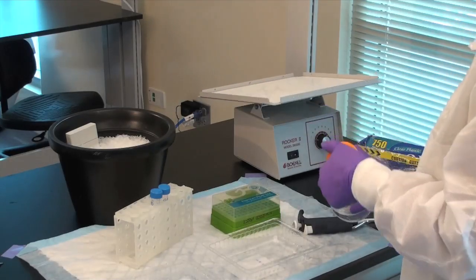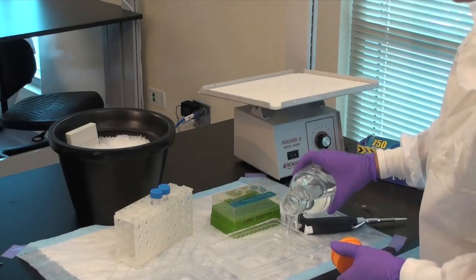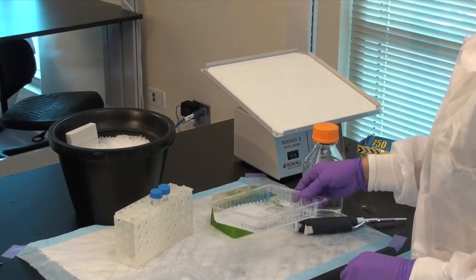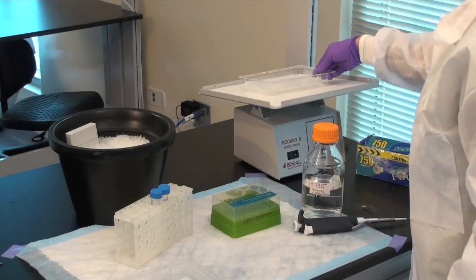Wash the membrane twice with TBST, then incubate it on the shaker with your primary antibody of interest made up in TBST for one to two hours at room temperature or overnight at 4 degrees Celsius.